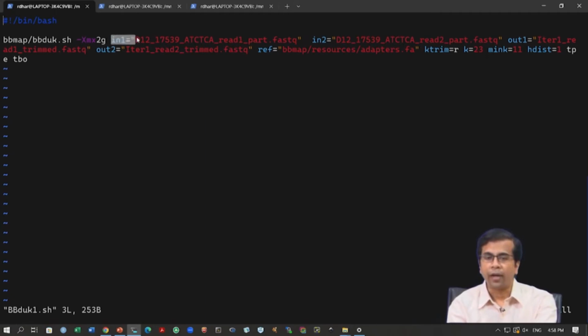Then you have the input file names, in1 d12 17539 etc. read1 part.fastq. This is the first fastq file, then you have the second fastq file. This is required because we are dealing with paired end data, so we need to give both files at once.